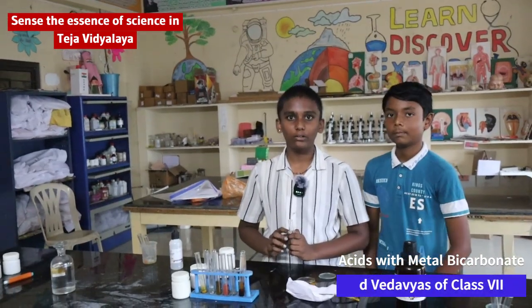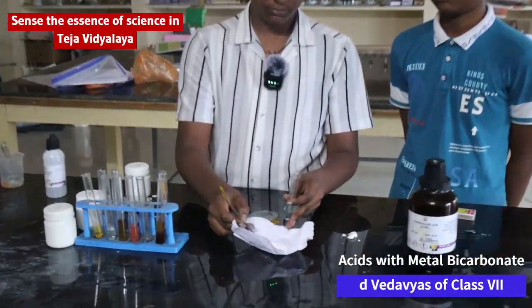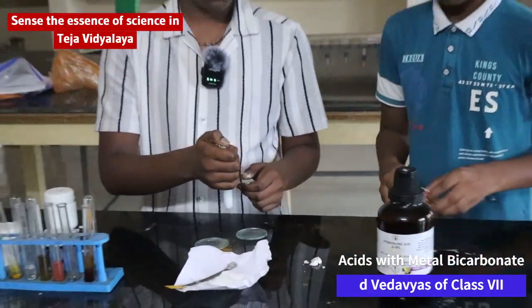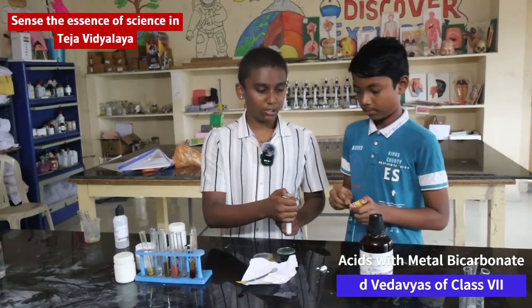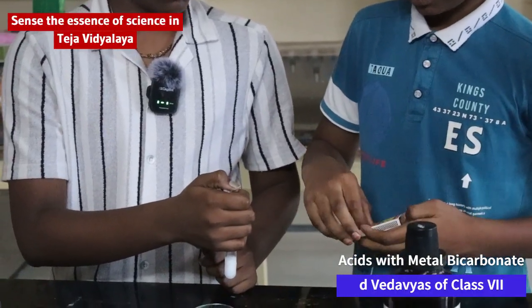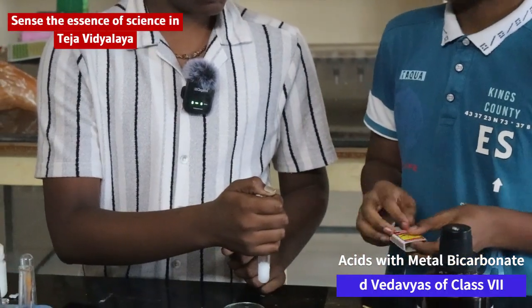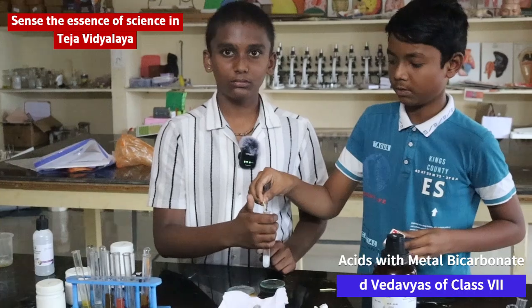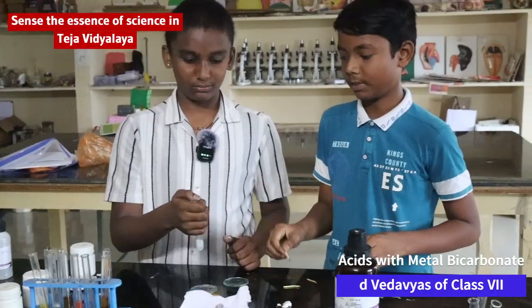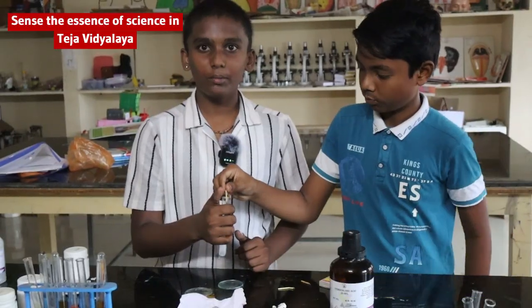Now I would like to share sodium bicarbonate. When we add sodium bicarbonate to acid, it releases carbon dioxide. You can observe. What can we observe? Now we can observe carbon dioxide releasing from sodium bicarbonate.